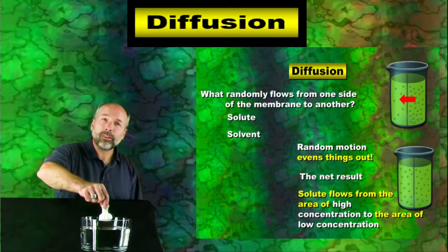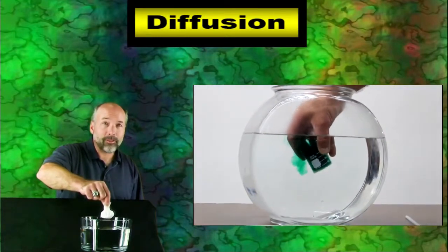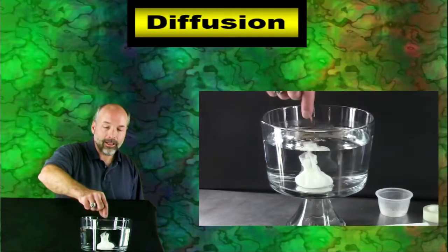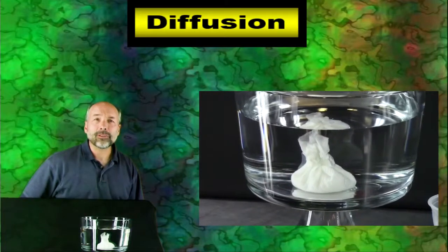One other example that we could think of for diffusion would be having a perfume bottle, a real stinky perfume bottle. All this stuff is concentrated within the bottle itself. As soon as you open the cap, the perfume molecules are going to leave it and begin filling up the room that the perfume bottle's in. Another example of that would be food coloring. You put a little drop of food coloring, that's the concentrated stuff, and it spreads out evenly into the various areas. So with that said, let's go do it. We're going to let it just drop inside. And you can watch this and see if we see any evidence here that diffusion is taking place. We'll see you in a little bit.